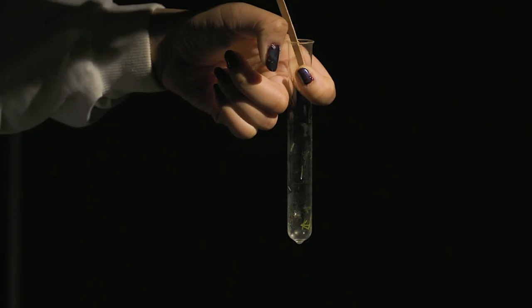By setting up some pondweed on a windowsill and collecting the gas for a few days, you can then show the students that the gas collected is oxygen rich by reigniting a glowing splint.